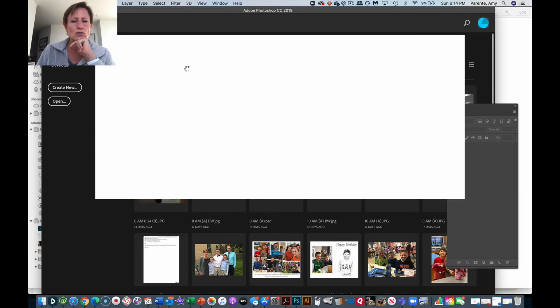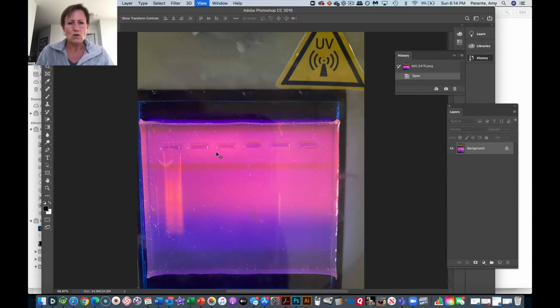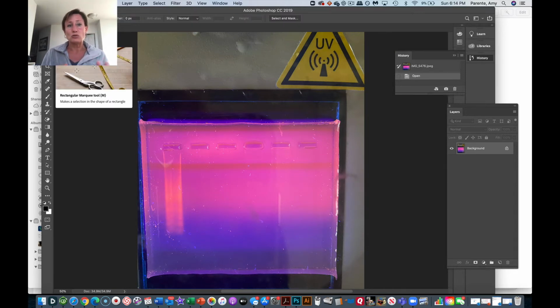So I'm just going to show you some different things that you can do with this. First thing I'm going to do is crop it. And as I go through this, I'm going to highlight things that are okay to do to manipulate a gel image versus not okay to do. Big general rule of thumb is you don't want to create something that didn't exist normally.